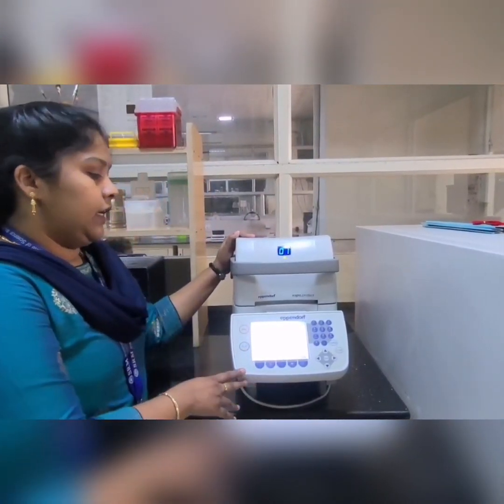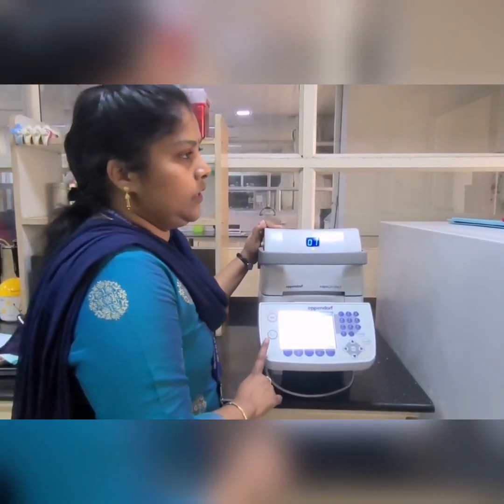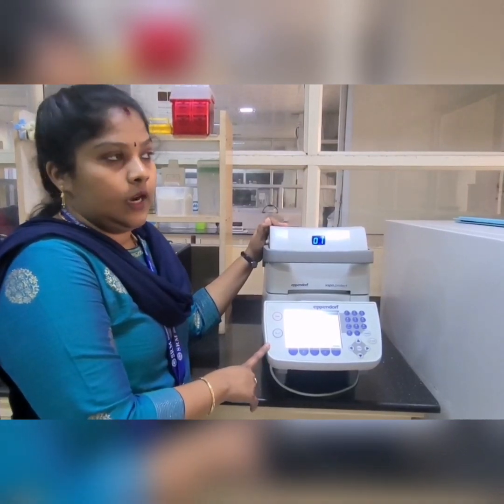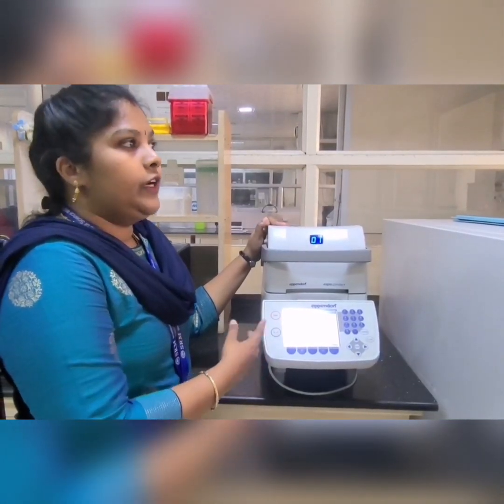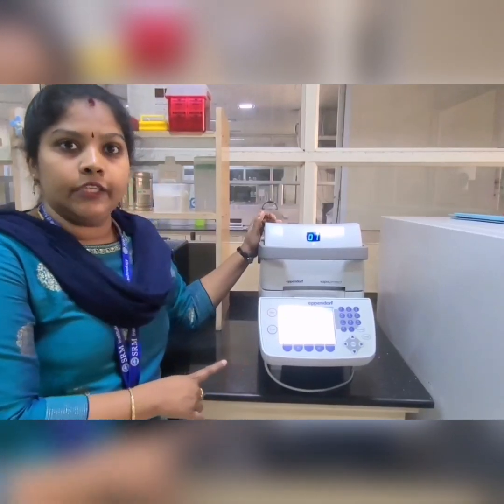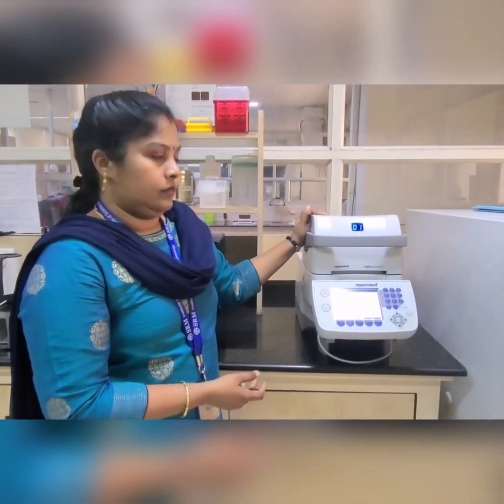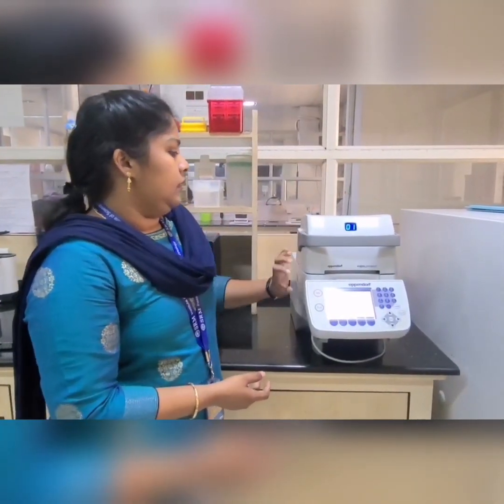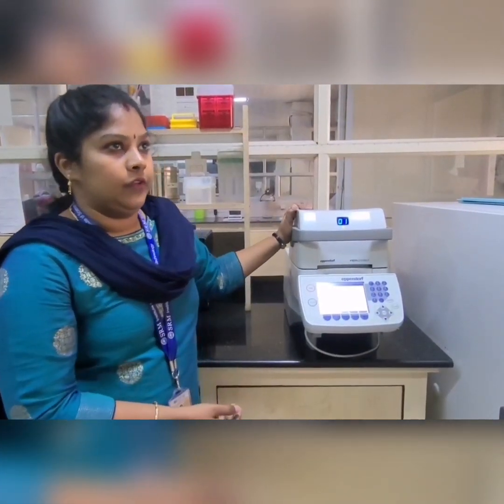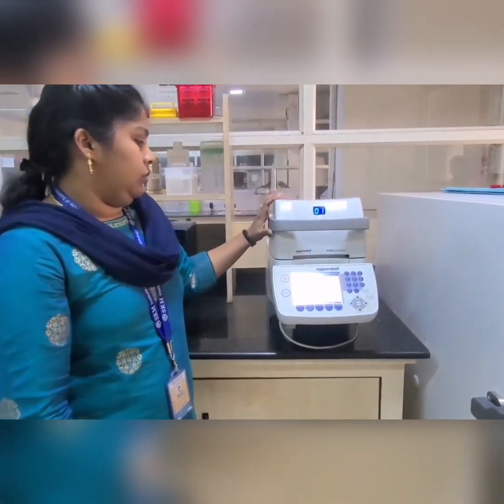Since this is a gradient PCR machine, we can use different temperatures. For example, if you are standardizing any PCR reaction you can use different temperatures and then see whether you got an amplification.